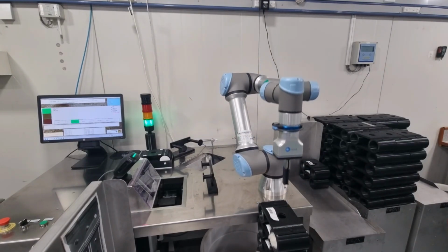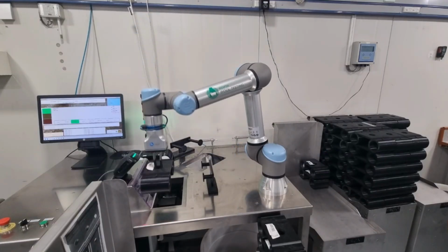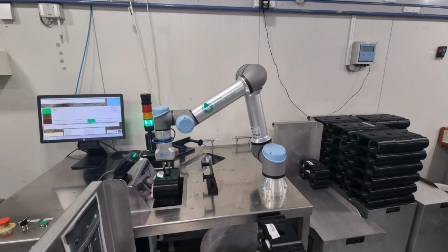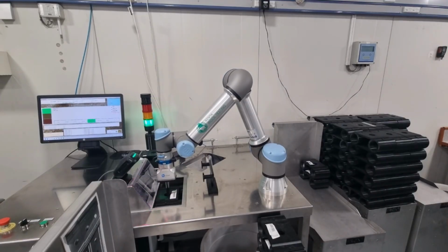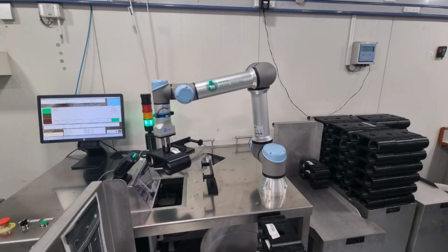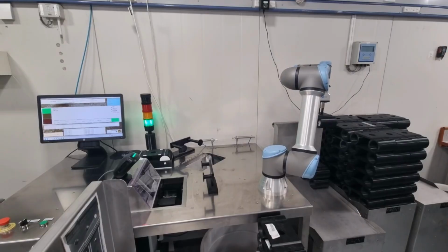The difference between the green and blue values, reported as Y-Z, represents the degree of yellowness in the wool. The higher the Y-Z value, the more yellow the wool. Y-Z values can range from less than 0 units to over 10 units in New Zealand wool, with very white wool having a negative Y-Z value.